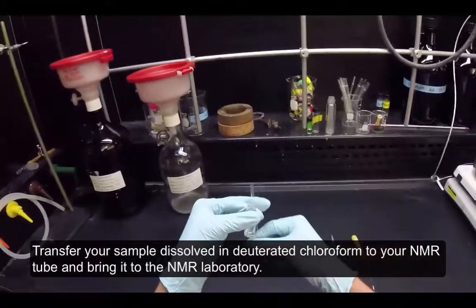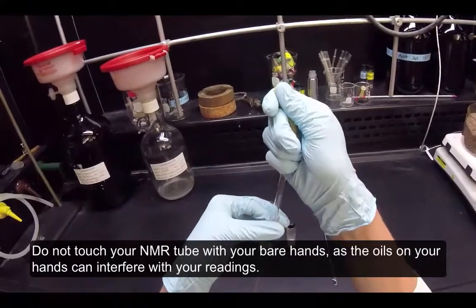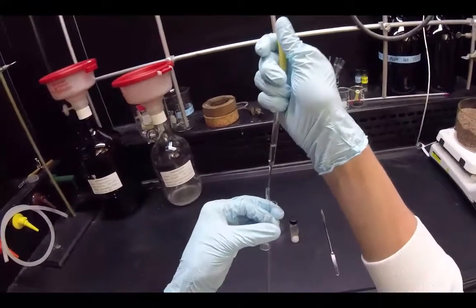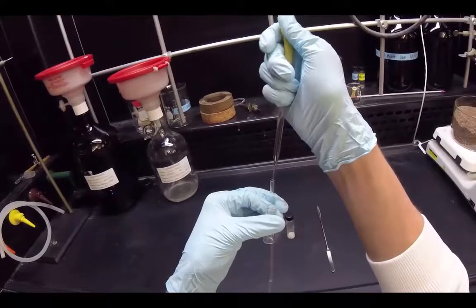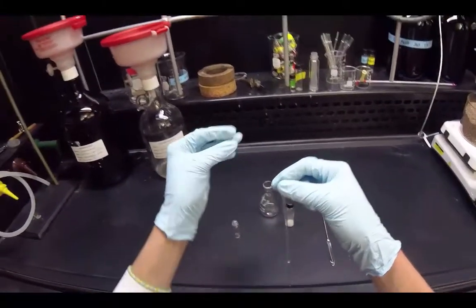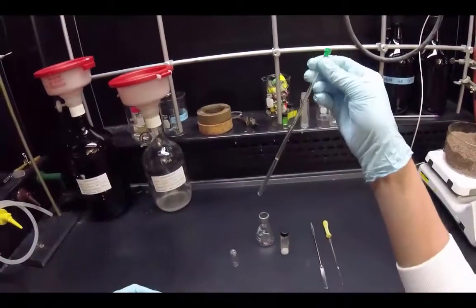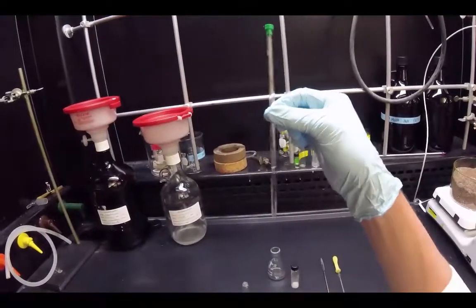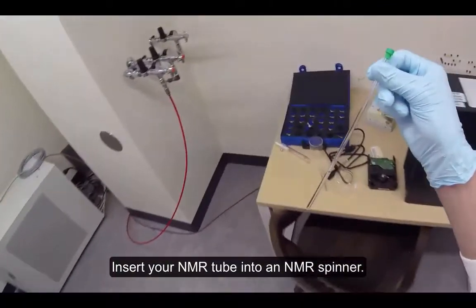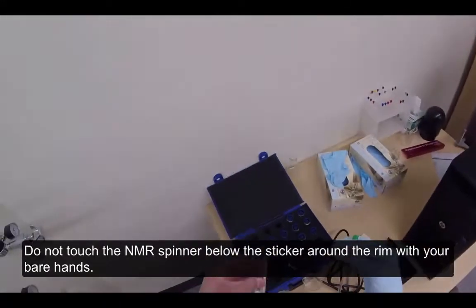Transfer your sample dissolved in deuterated chloroform to your NMR tube and bring it to the NMR laboratory. Do not touch your NMR tube with your bare hands, as the oils on your hands can interfere with your readings. Insert your NMR tube into an NMR spinner.